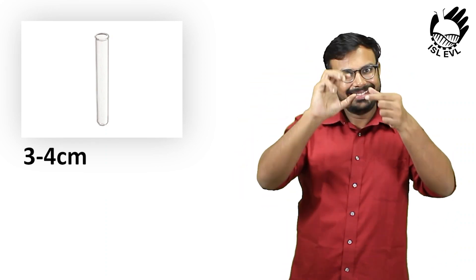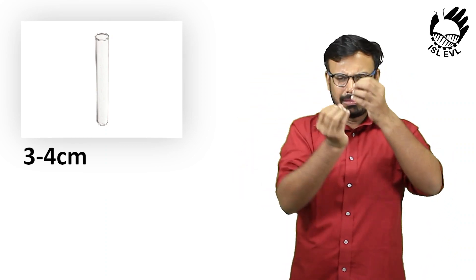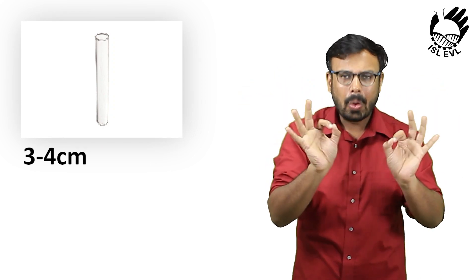If your sample does not fizz, then split the mixture evenly into two clean test tubes.